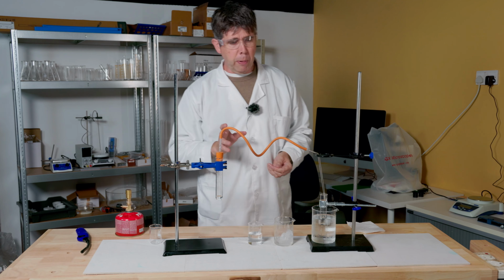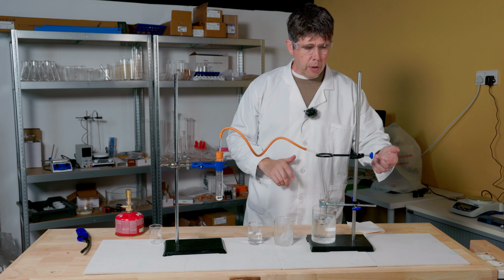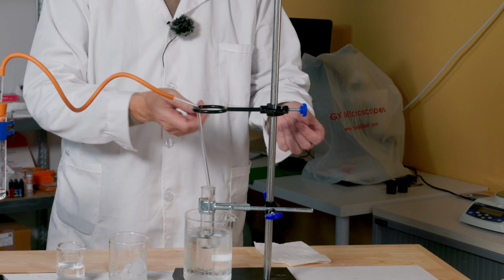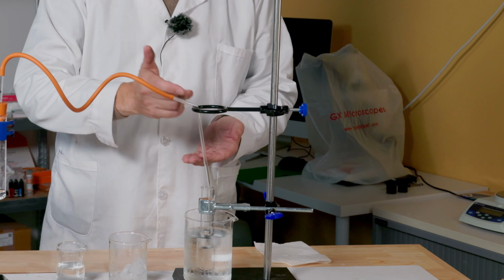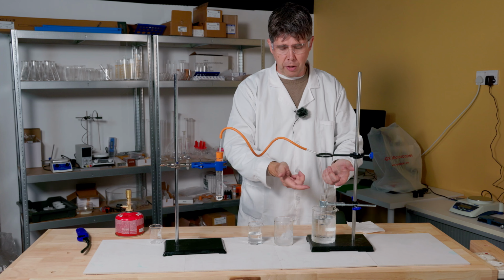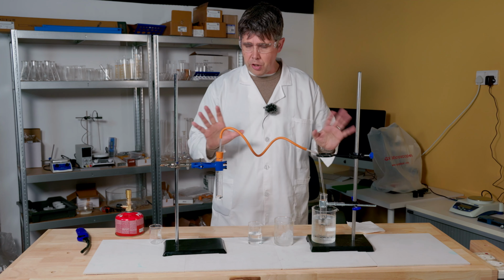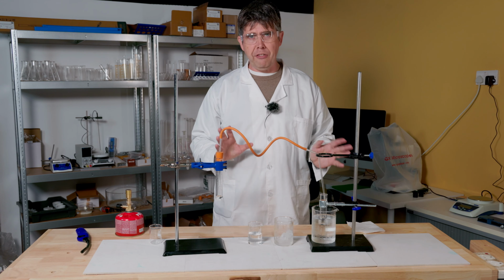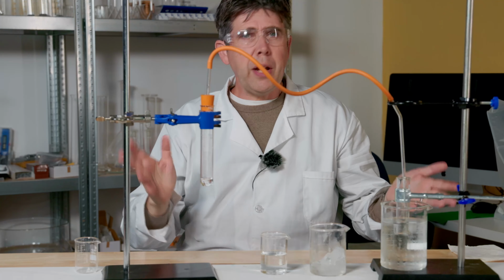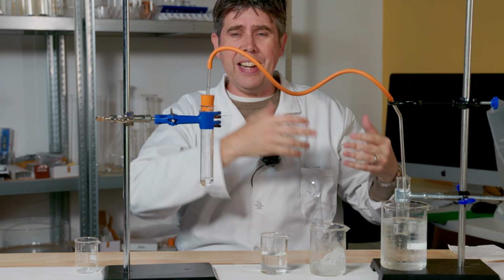Secondly, the problem is that this equipment is all still quite hot. So now you can see the importance of this little metal ring here, because it's allowed me to lift that glass tube out of my delivery vessel, this boiling tube here, without having to touch it. And in fact, I'm now not going to touch any of this equipment for about 5 minutes while it all cools down.